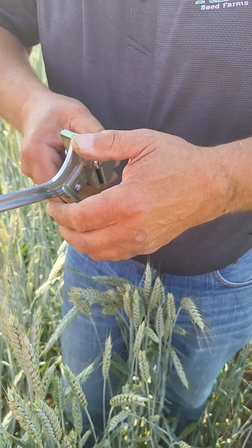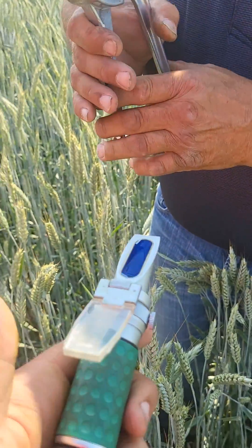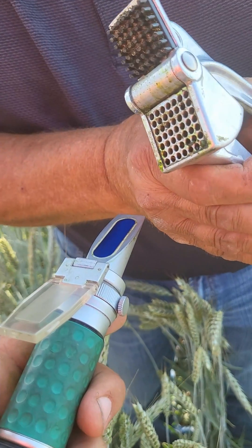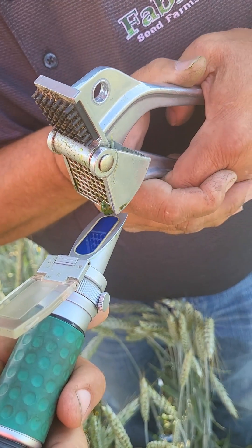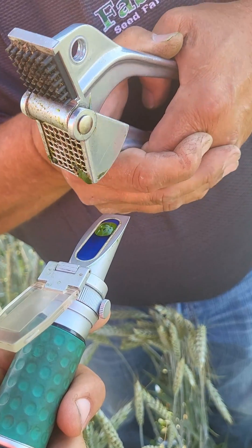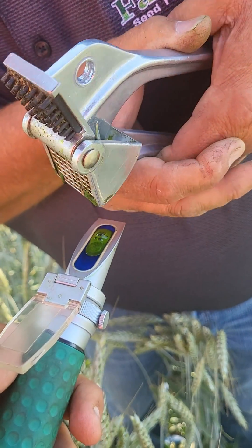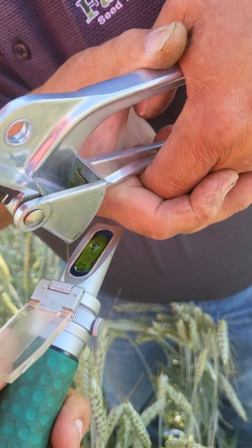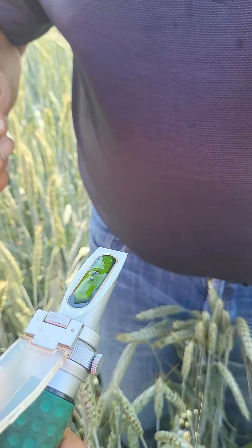Once dad's finished he's going to start pushing through, and you want to make sure that you're pushing gently and sort of milking it so that you're not getting too much plant tissue through, but just the sap. By measuring the content of the sap, we're going to look at how much light is refracted through the sap via our refractometer, and that'll give us a general indication of overall plant health.